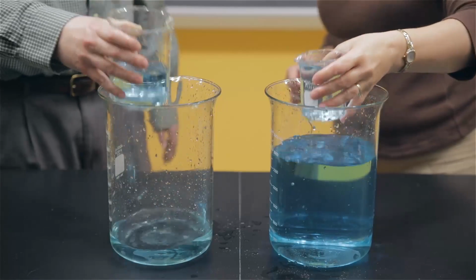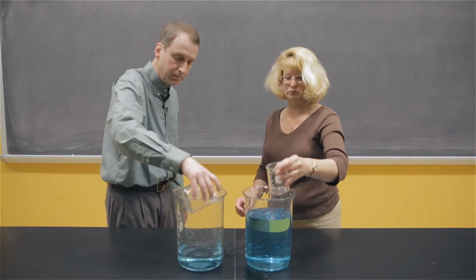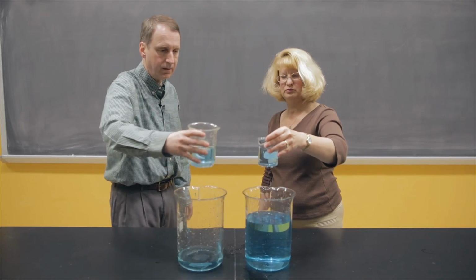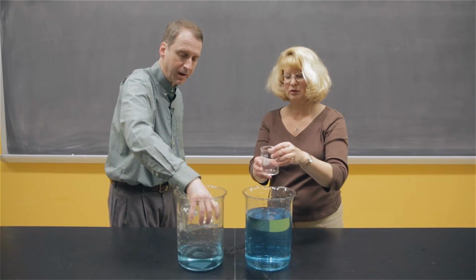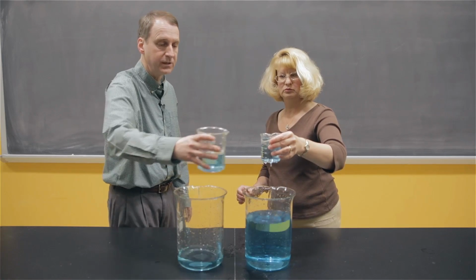By the markings on the side, I'm between 250 and 300. Not that those are accurate, but they're probably fairly close. And now we're to a point where we're pretty much transferring the same amount of water in each transfer. And this system has reached equilibrium.